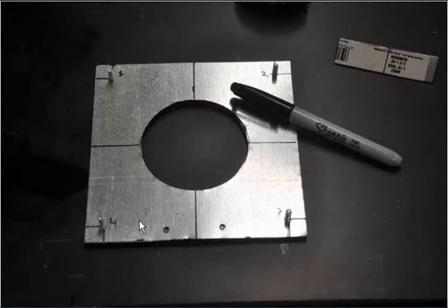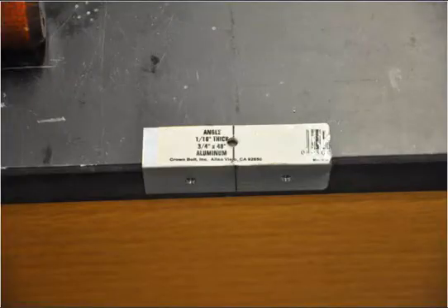So once we drill the holes in the first plate, we're going to do the same procedure. We're going to line up both plates, actually put in the screws to make sure it all fits together, and then mark the holes for the mounting bracket on the second plate. So we'll call this little 3-inch aluminum angle iron the mounting bracket, if you like.